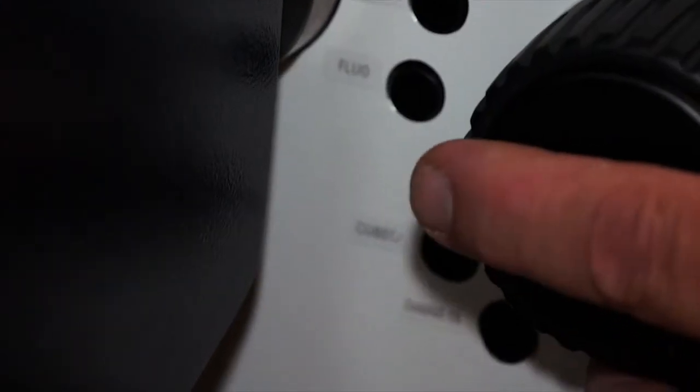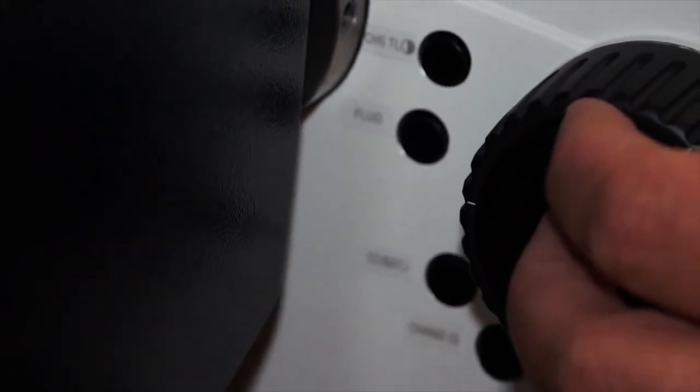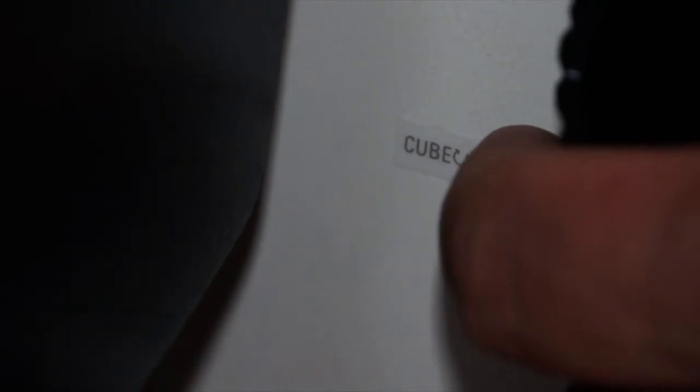Four important buttons are found on the left side of the instrument just inside the focus knob. The third button down allows you to actuate and toggle between the different filter cubes, just as you did on the front of the microscope. This is very convenient if you're using two different fluorescent filter packages — you can toggle between them simply by pressing the third button.